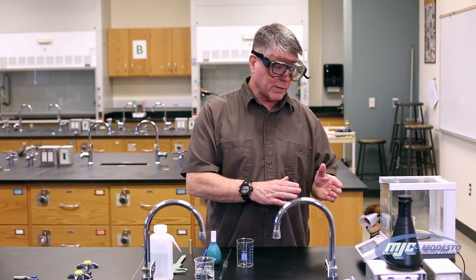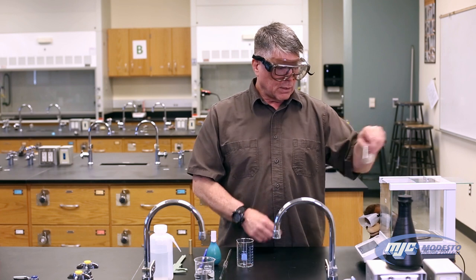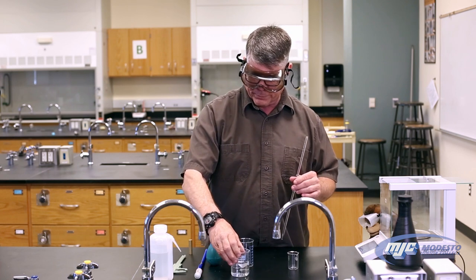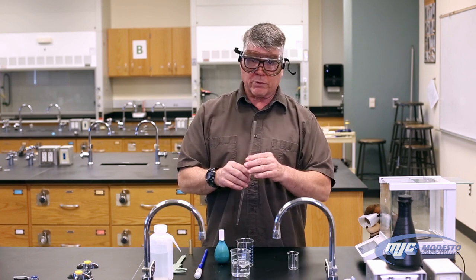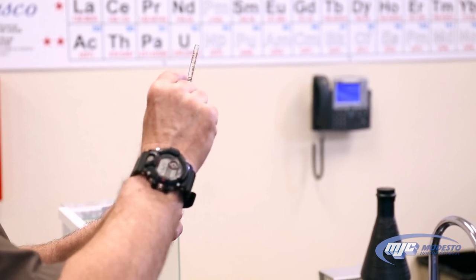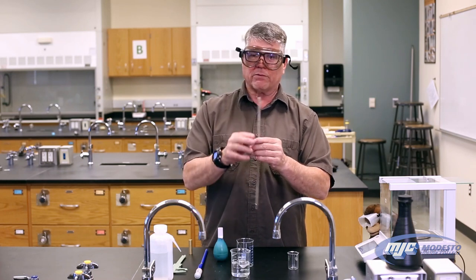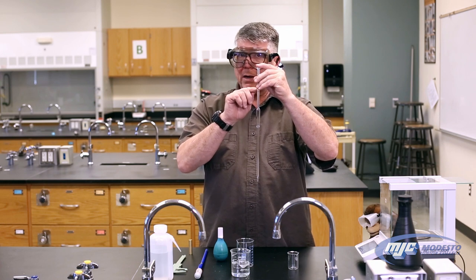We're going to measure 10 milliliters of water into the beaker and weigh it. You never add anything directly onto the balance, so we take the beaker out. I have some deionized water, and I'm going to use this volumetric pipette with a pipette bulb. There's a line on each volumetric pipette somewhere in the neck — it's going to be in different places for different pipettes because they're all calibrated. We're going to use the bulb to pull the water up above this line.